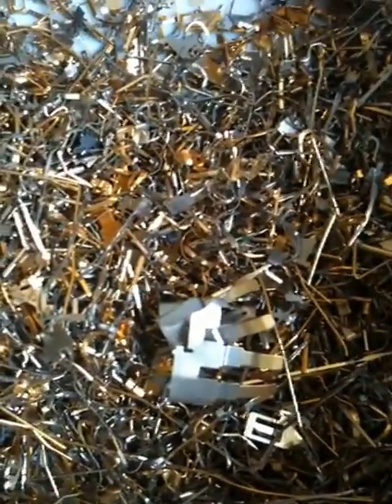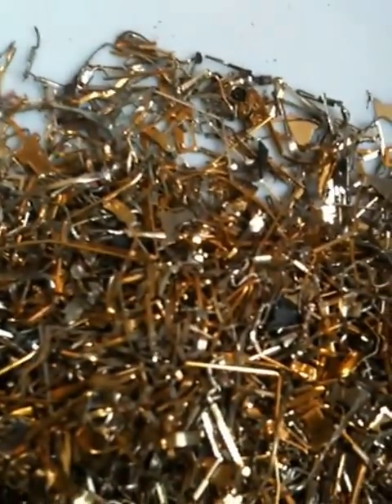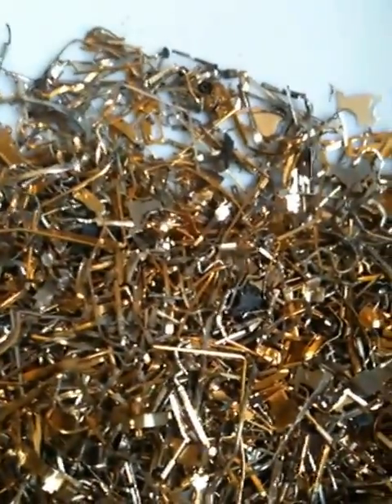And I've always fixed people's computers and kept all the bits I've ever got, and I finally started stripping them all out. And this is 200 grams of gold pins. These gold pins are what I've taken out of cards, motherboards, etc. As you can see, every type of gold pin in there — this isn't CPU pins, this is just all the connector pins, from all the different types of connectors you have, whether it's SATA or PCI, anything.